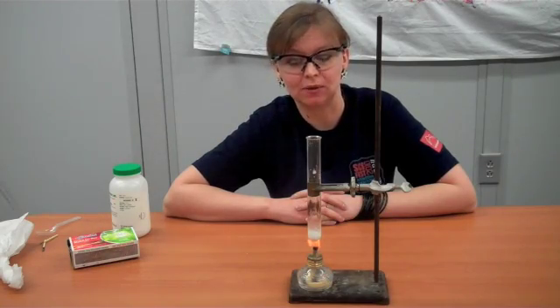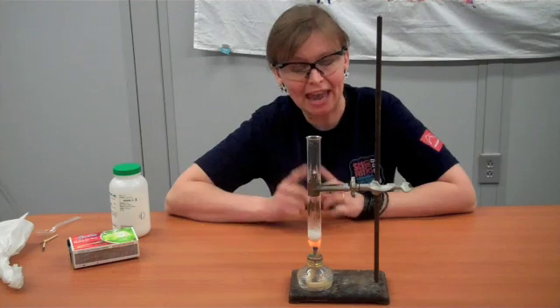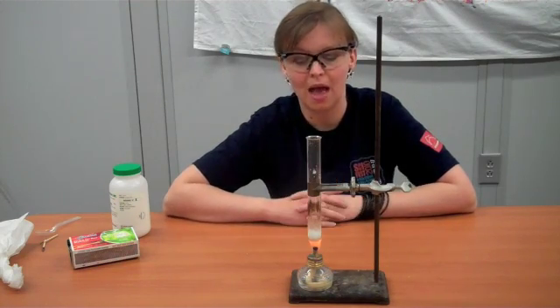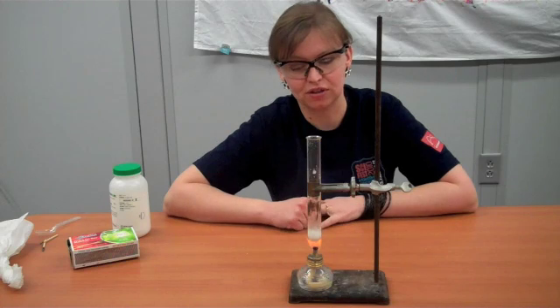Hey everybody, it's Amanda from the St. Louis Science Center with an experiment you cannot try at home, but nevertheless I wanted to show this to you.